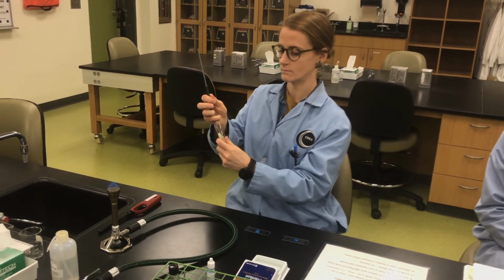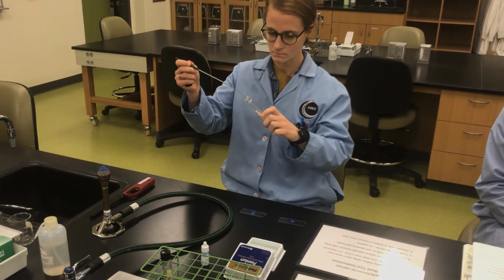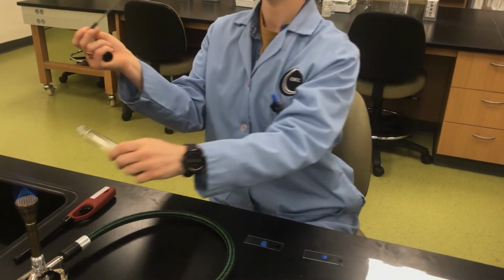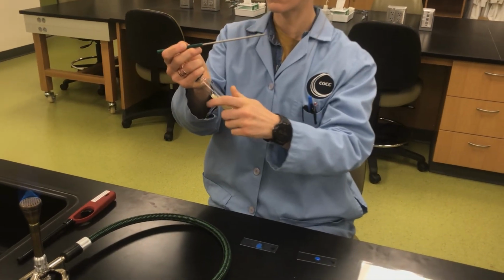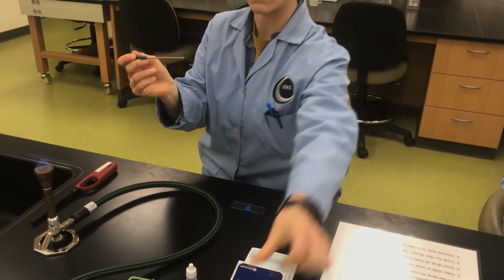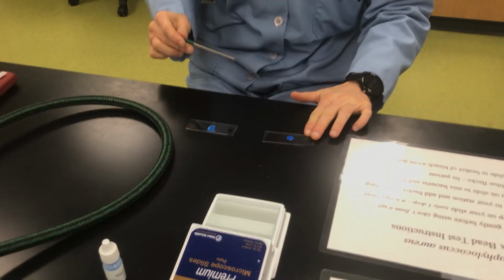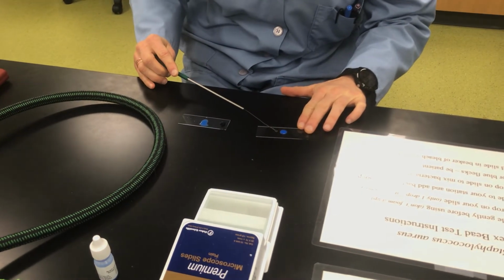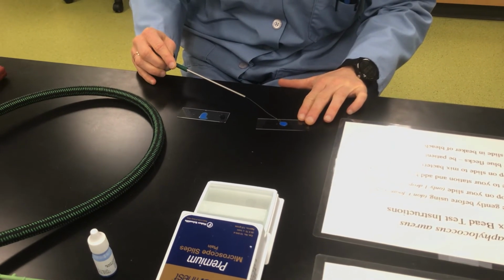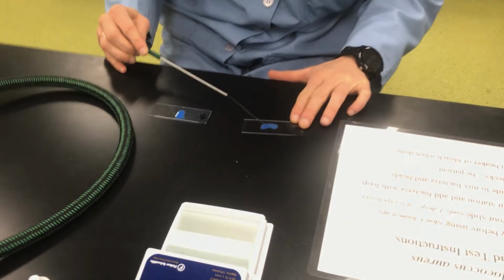Good aseptic technique. Pinky. Awesome. All of these skills that we are becoming familiar with. And once again, she'll put the tube down so that she doesn't feel like she has 1,000 things in her hands. So again, smear the bacteria on the glass next to the drop. And then drag the drop with your loop over the bacteria to mix them. So get it nice and mixed.